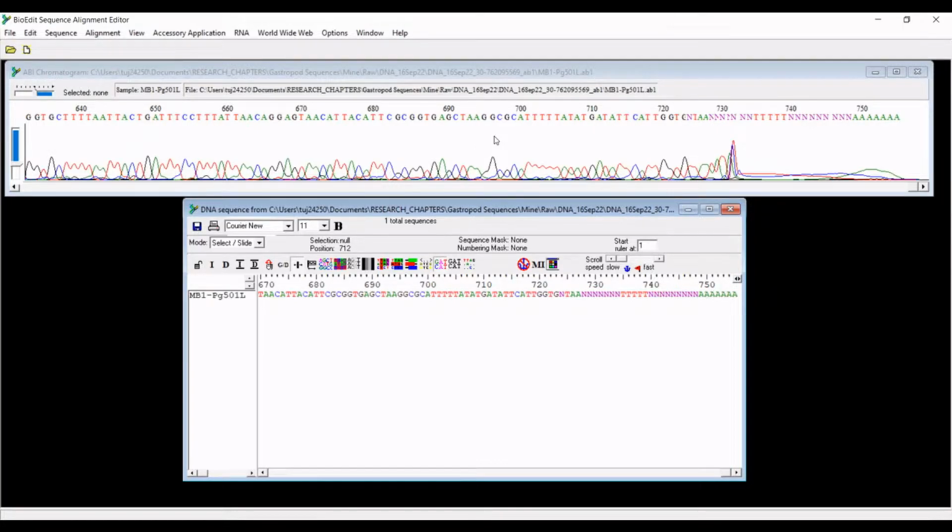And so to start, typically most sequences will have this very messy end at the end of the sequence, usually following the primer sequence that you used. And I know that typically the primer sequences have a repeating base. So in this case, it's this block of repeating T's from about 701 for 5 positions. And you can see that actually down here. I should have done that, sorry.